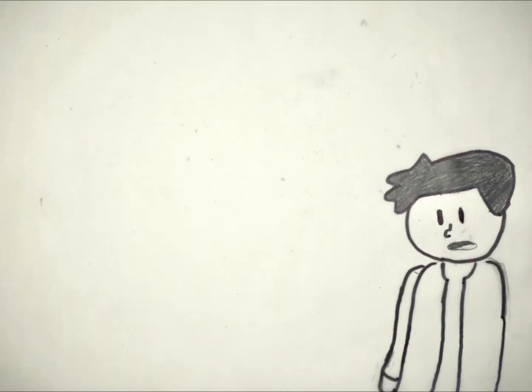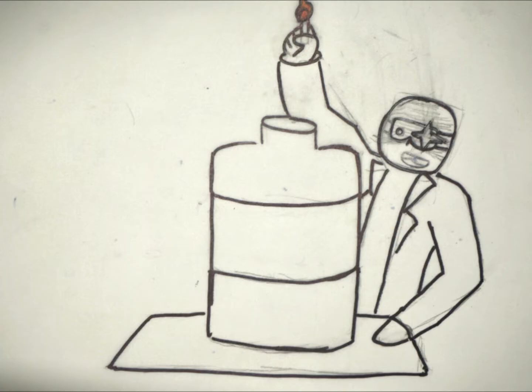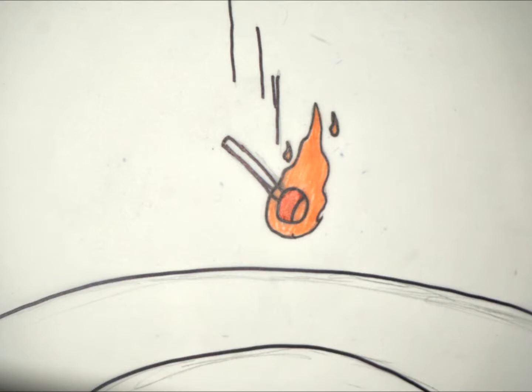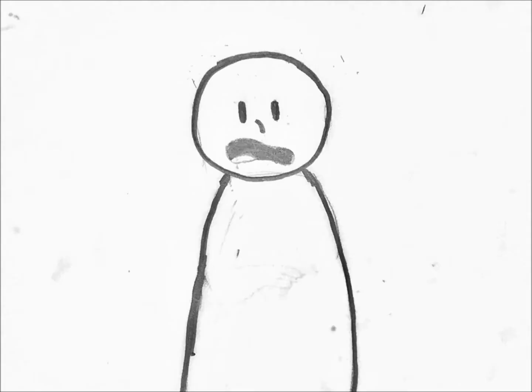Just as everyone was about to start the ice cream experiment, the high schooler was holding a lit match over a huge glass jug, which had what I guessed to be the methanol from earlier. Everyone kind of stopped what they were doing and just watched the high schooler drop the match into the jug. And we watched it slowly drop into the bottom of the jug. And can you guess what happened? The match dropped to the bottom of the jug, no one got hurt.